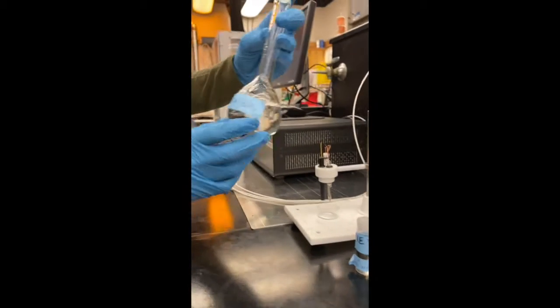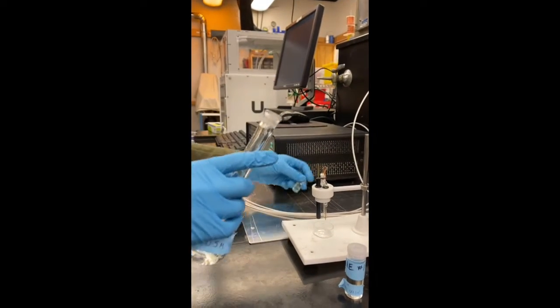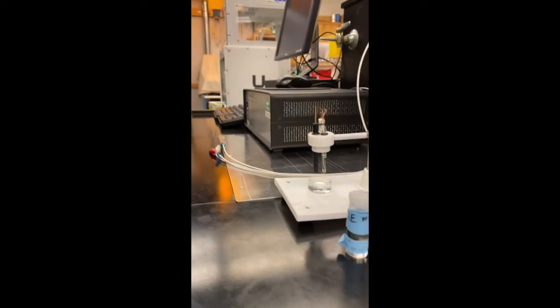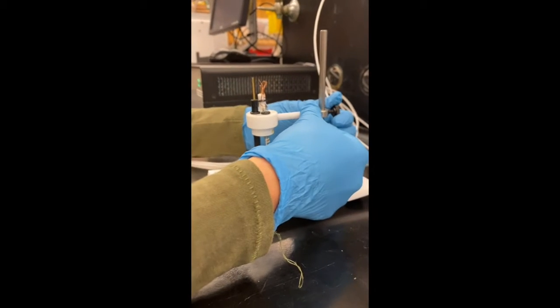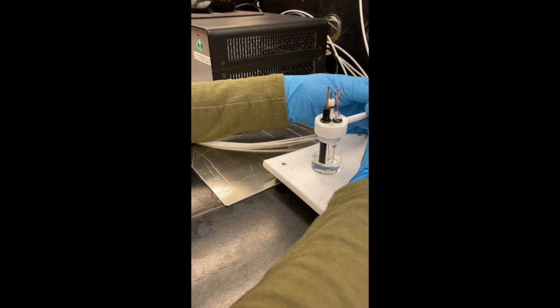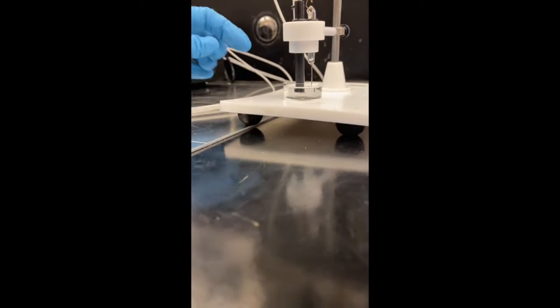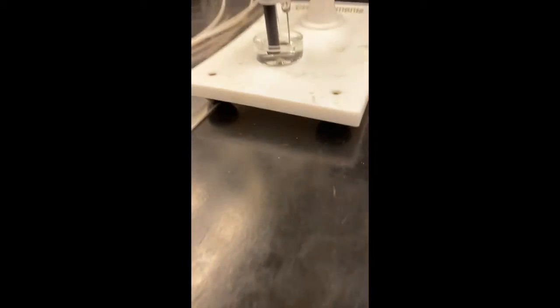And then here I have 0.5 molar sulfuric acid that we're going to use to clean the electrode. So I'm going to add that here to the glass cell. And we're going to lower the 3 electrodes in. Here we want to make sure that the tips of all 3 electrodes are immersed. You can kind of see that at the front here. And that the cell is kind of in the center of all 3 electrodes.